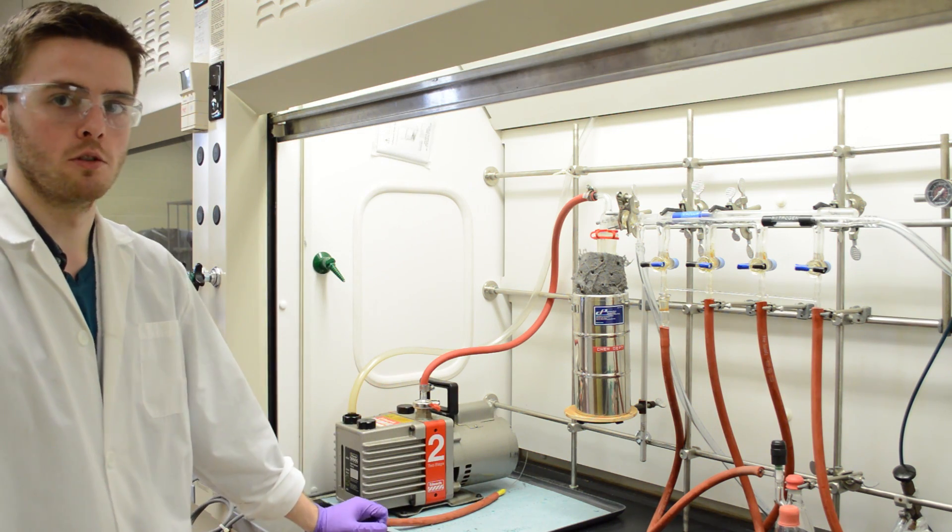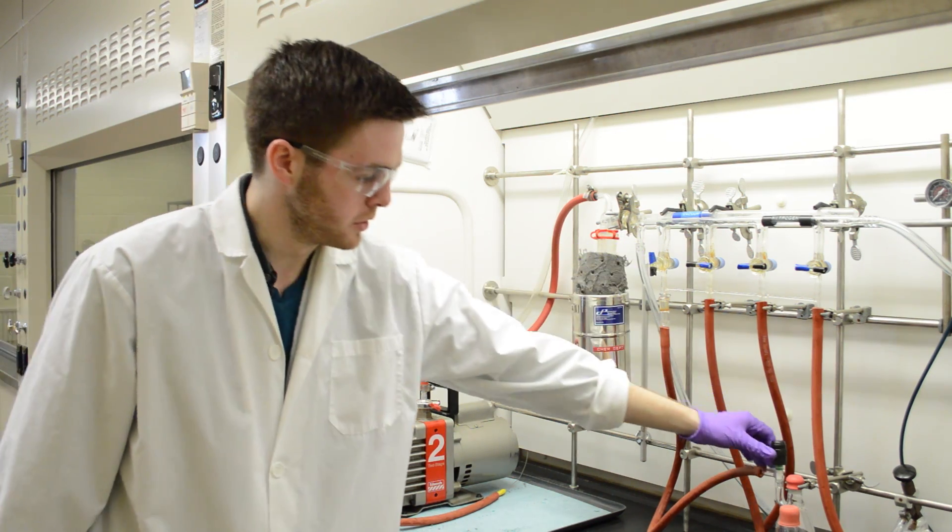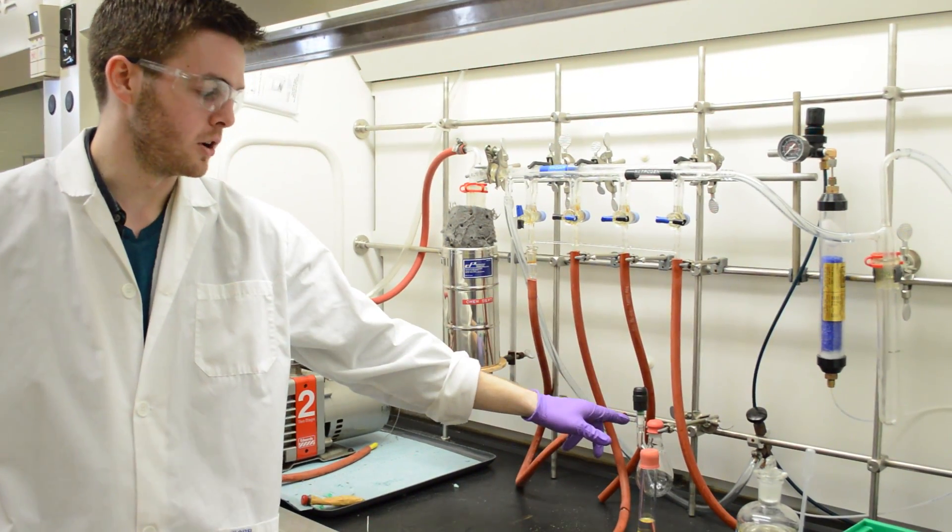So we're going to give this a second to run to make sure there is no air left in the system. Then we'll apply the vacuum while this valve is closed, just to draw any oxygen out of the stem.